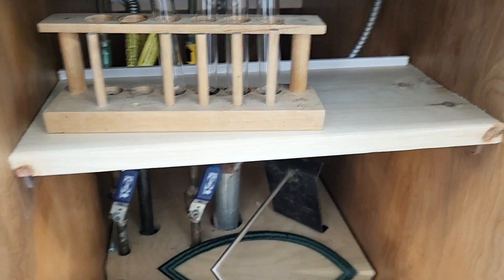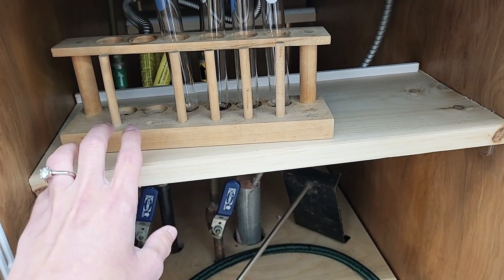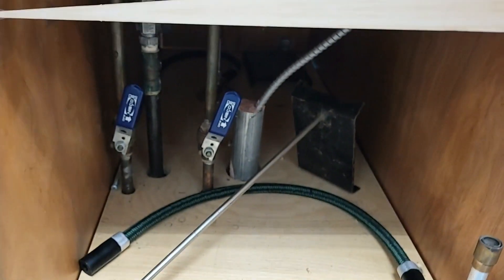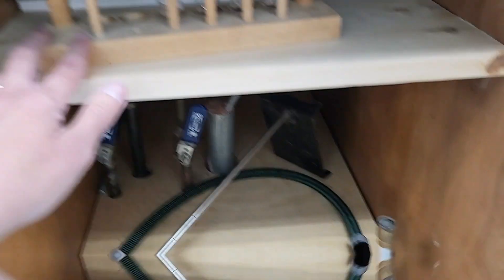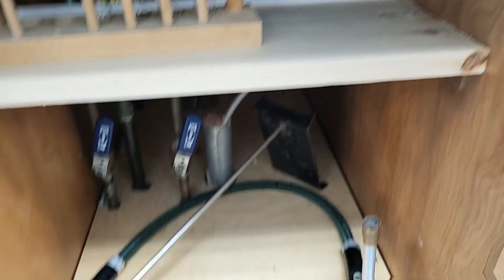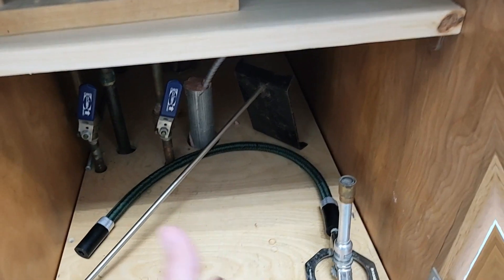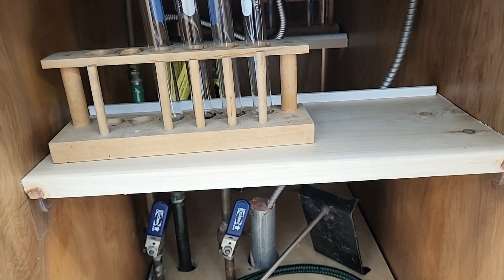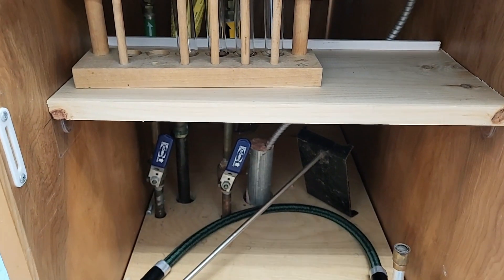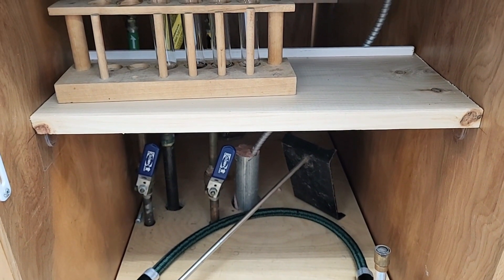Down in the cabinet I have a test tube rack, a ring stand, and a Bunsen burner. I had my fiance cut a shelf and add a little lip on the back so that if students put something back there it won't fall over. I don't have the space for beakers down here and I was worried they'd break when students remove the Bunsen burner or ring stand. Thermometers and crucibles I store on the shelf instead to avoid breakage.